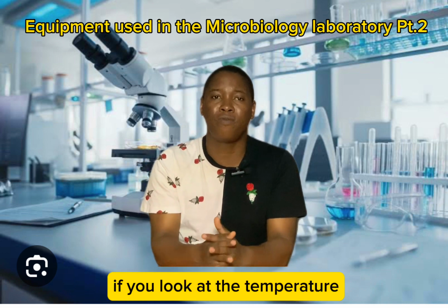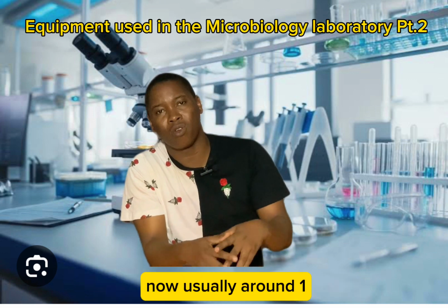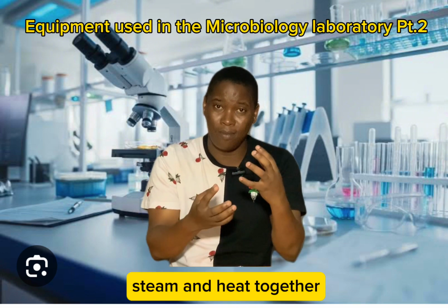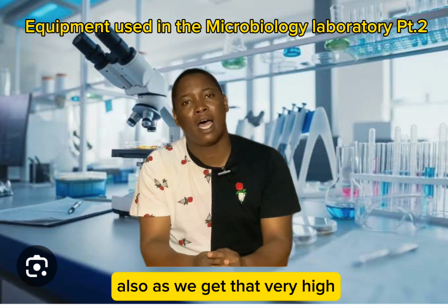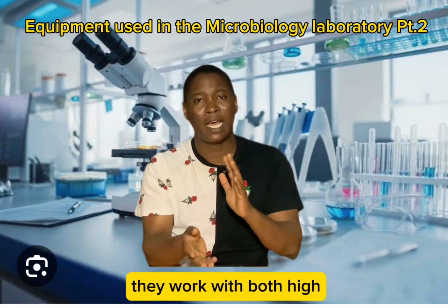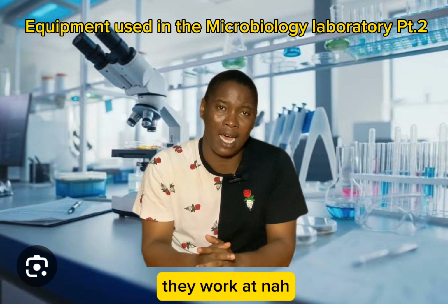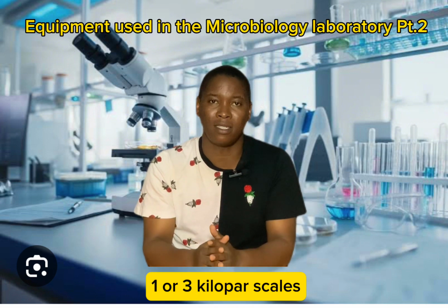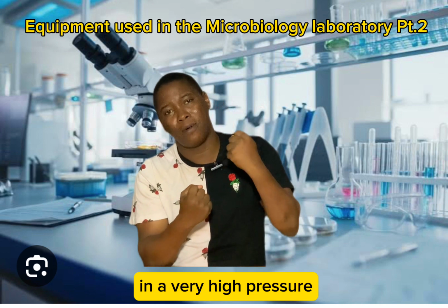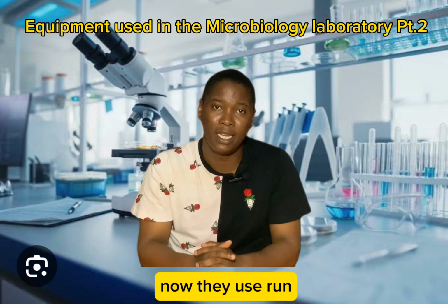We will destroy them totally using that steam and high pressure. Now many a times, if we look at the temperature wey we dey use for inside autoclave, that temperature na usually around 121 degrees Celsius, so e dey very hot, and na steam and heat together. Also, as we get that very high temperature, we dey get very high pressure too. So the thing dey work with both high temperature and high pressure. The pressure wey many of our autoclaves dey work at na 103 kilopascals. This one na the unit wey we dey use measure pressure. So na very high pressure situation, both high pressure and high temperature na we dey use run the autoclave.